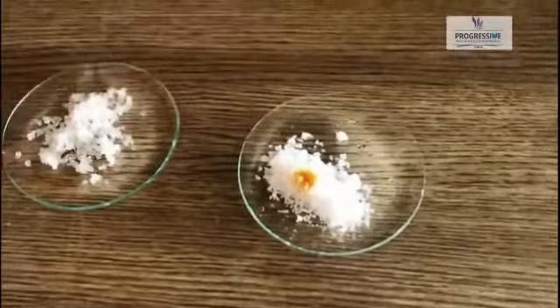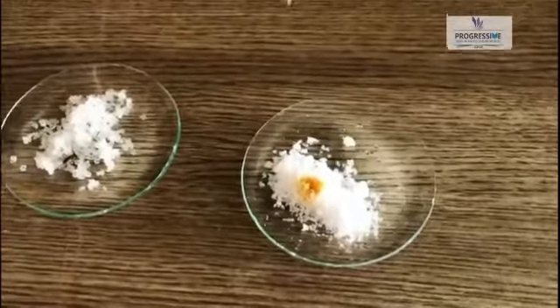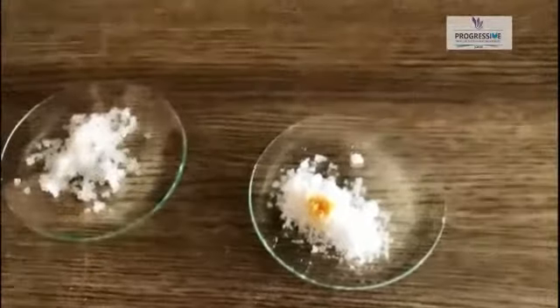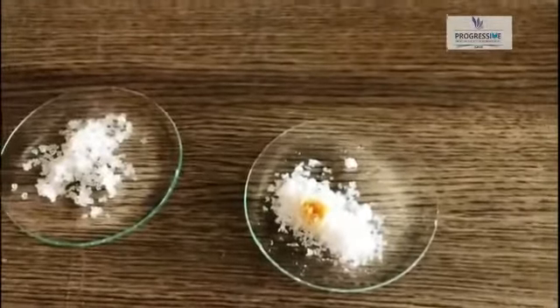Can you see any color change here? We cannot see the blue-black color in the salt.